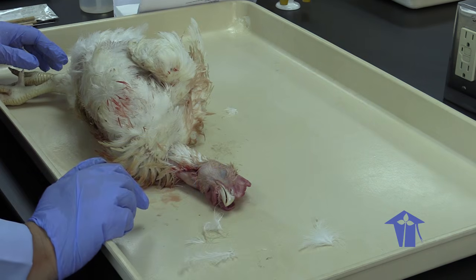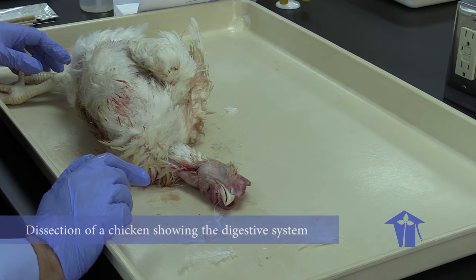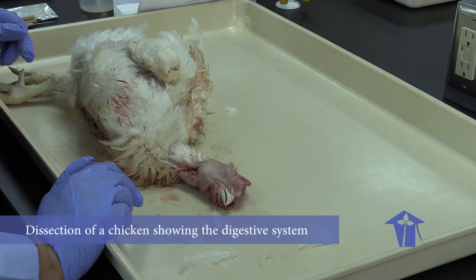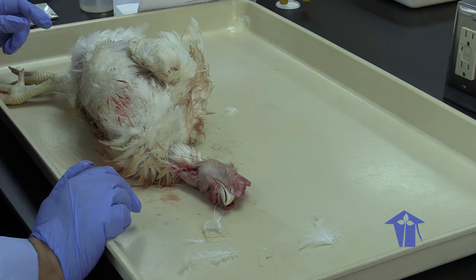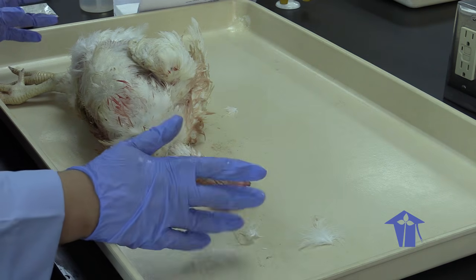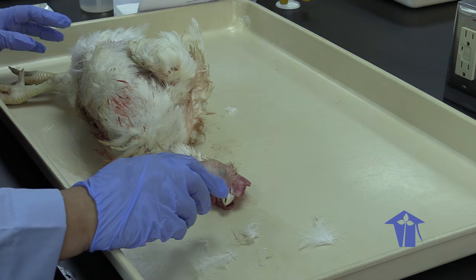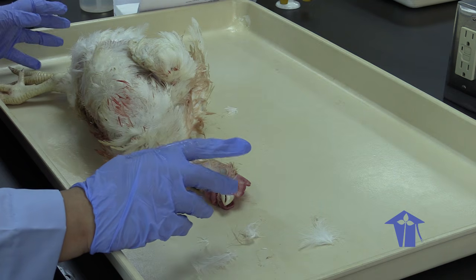So what we're going to do today is to dissect a chicken. This is not a common fowl or a layer. This is one of the chickens that we use for ordinary consumption. So basically this guy has been bred to be eaten.